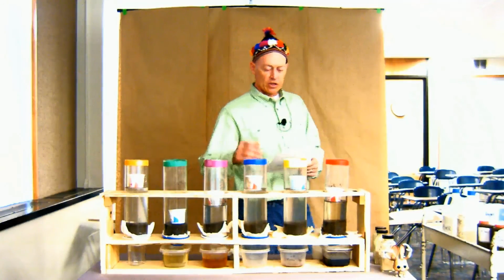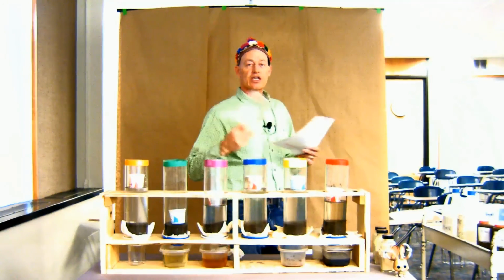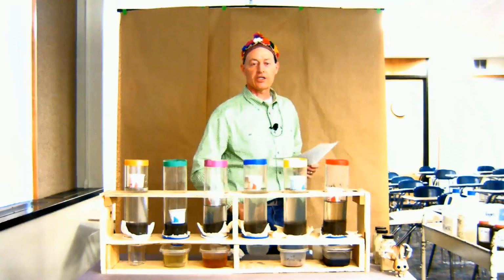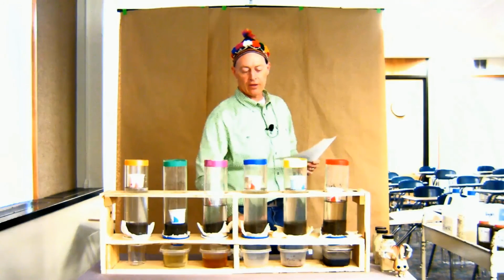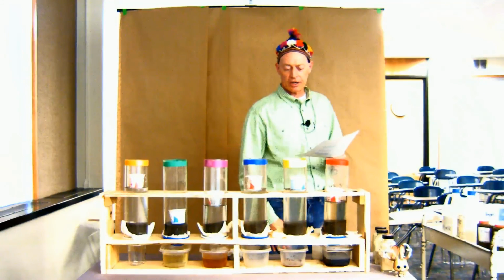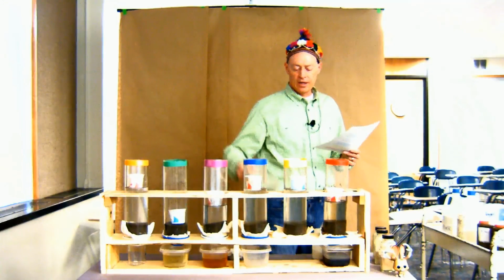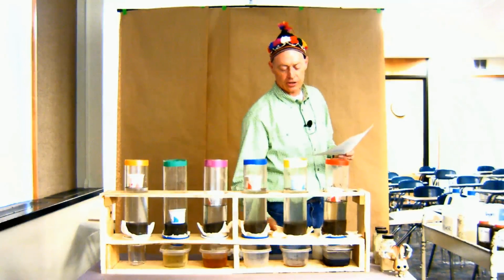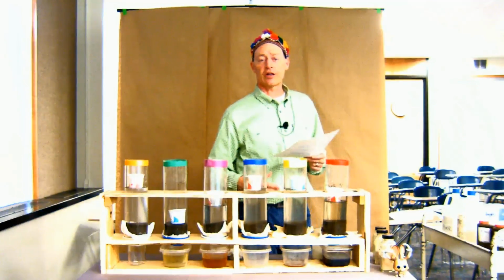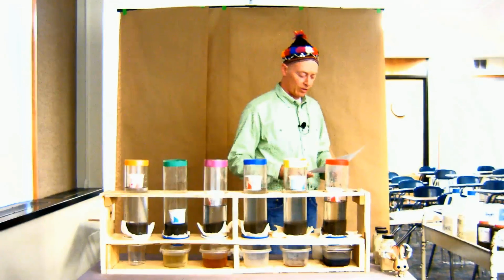This one is the commercial gypsum, the pelletized gypsum. Okay, the solubility is the same. From the powder to the pellet, the solubility is the same. It's just the surface area to volume ratio that makes the difference. This one's the spent lime, again using deionized water. It's going to start moving over time, but it's certainly not the best option. If it's the only thing you have, it's the only thing you can get, it's not going to hurt anything, especially if you're interested in it from a phosphorus standpoint as well.